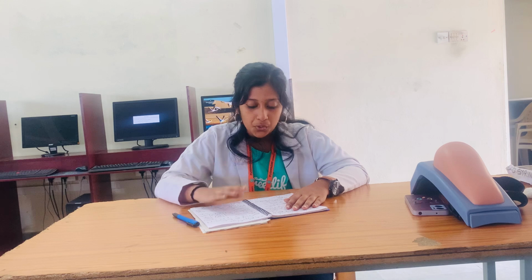So here there are two types of study, acute toxicity study, which follows the OECD 423 guideline. Here we use 6 animals. There are 2 steps, 3 animals each. And then there is a sub-acute toxicity test, which follows the OECD 407 guideline. It is a 28-day oral toxicity study, 10 rats per group, 5 males and 5 females. There are 4 study groups here: control, low dose, mid dose and high dose. 10 rats each, a total of 40 rats.